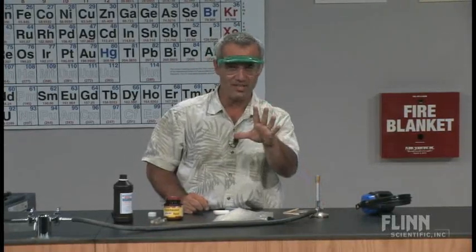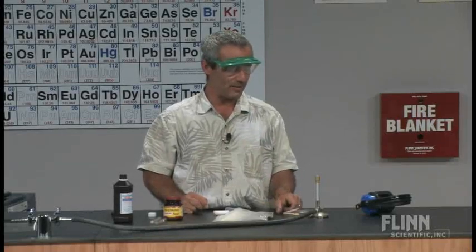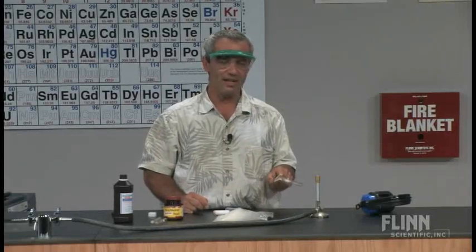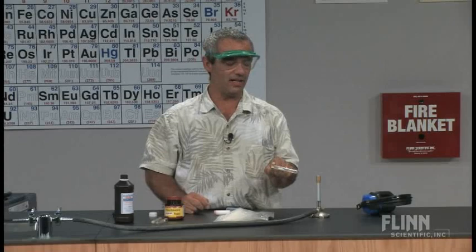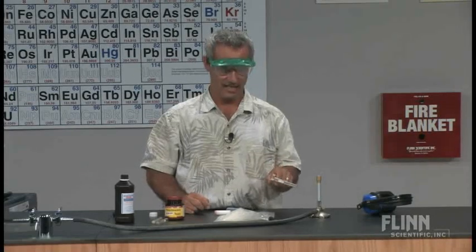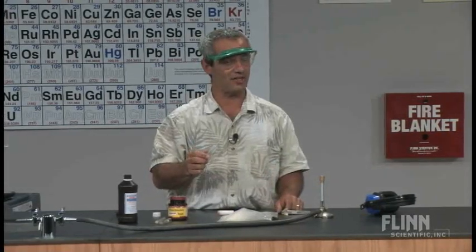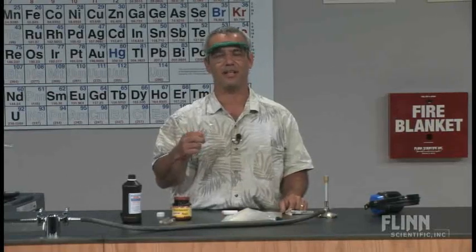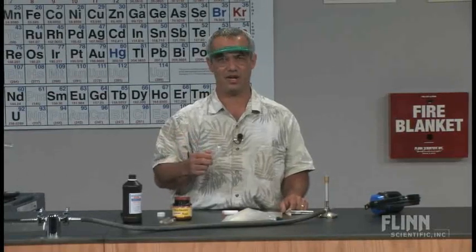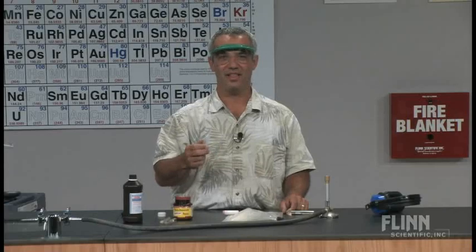So that was an example of a candle burning without a wick — got a little pop noise at the end where the two can mix in the flame. It's a nice example of combustion and of kinetics, because it didn't work with 20% oxygen — it's only going to work with a higher concentration of oxygen than that. Thank you very much.